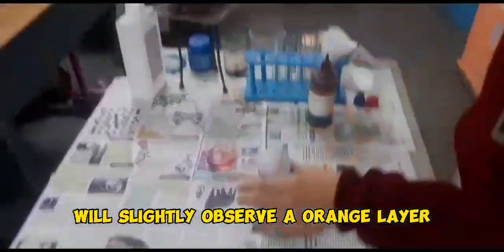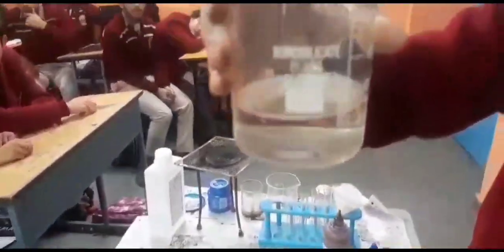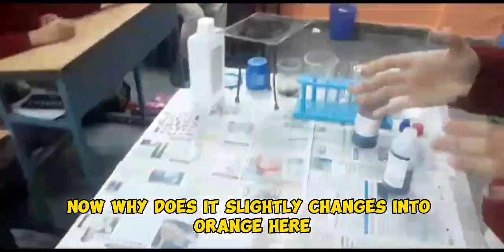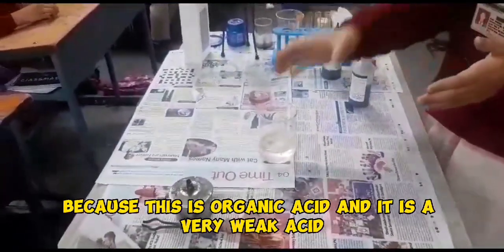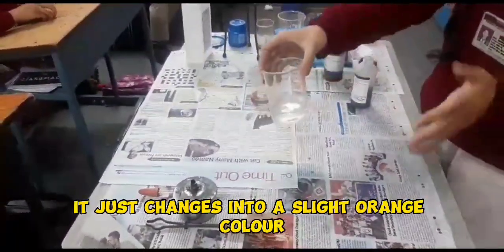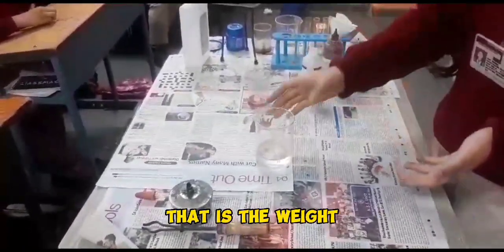Now I will dip the blue litmus in the ethanoic acid. We will observe that it slightly changes into orange. Why does it change only slightly? Here again a question arises. This slight color change is because this is an organic acid and a very weak acid, therefore it just changes to a slight orange color, and it also has a pH of 4, which clearly depicts that it is a weak acid.